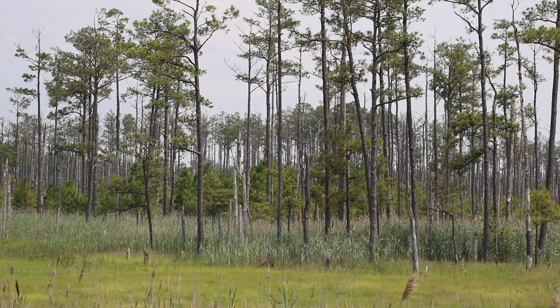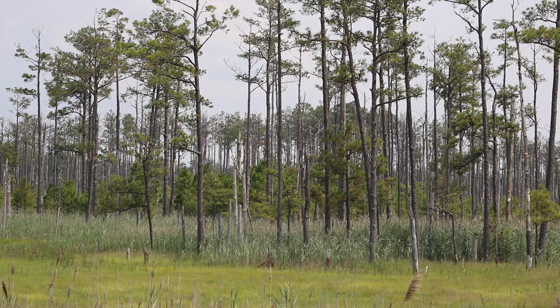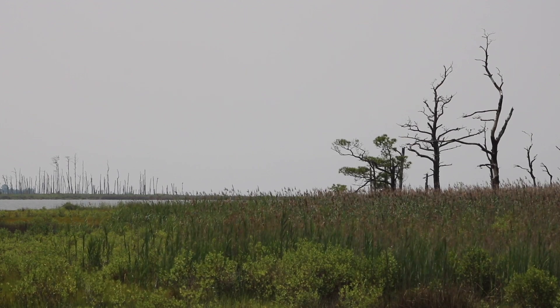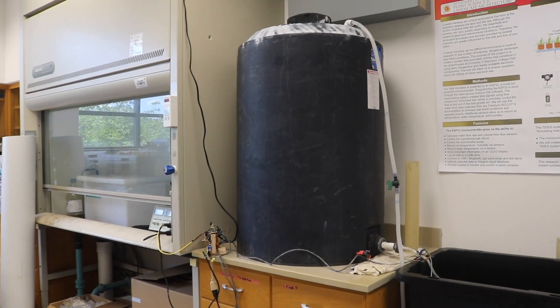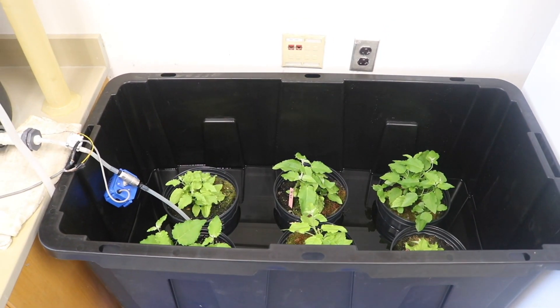We wanted to be able to accurately mimic tides — a gradual rising and falling of the water level within the growth bin. The device starts out from a reservoir, and the reservoir drains into our growth bin, which is the bin where the tide actually rises and falls.